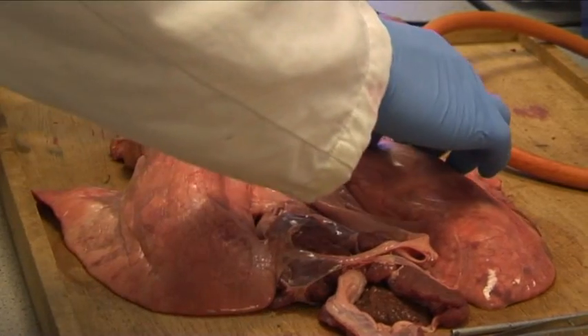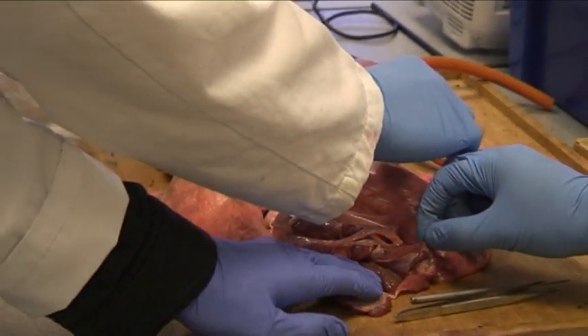Okay, well that was just a quick demonstration of how the lungs work. The next part of the session follows.